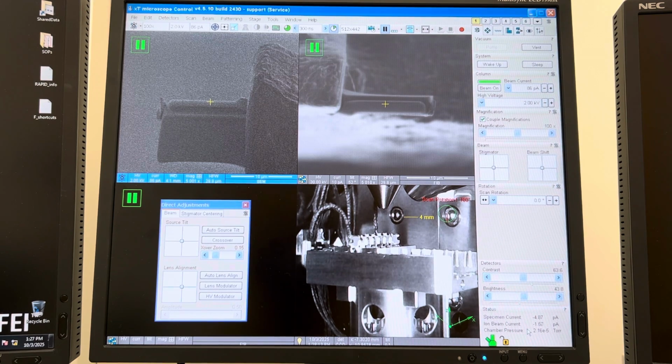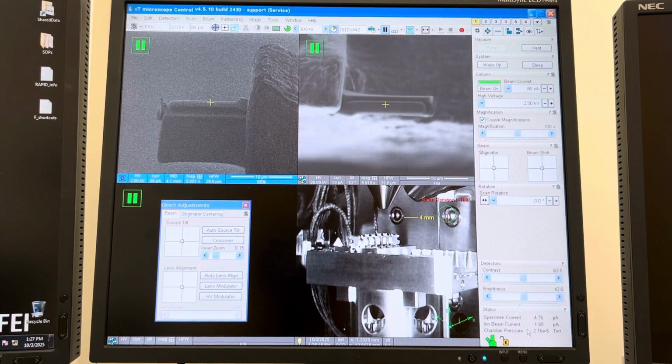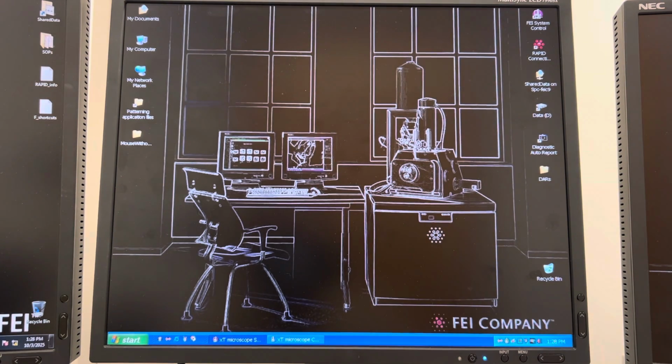It is Friday, October 3rd, 2025, and I'm here on the Helios Nanolab 600i again, and well, I'm kind of stuck. I don't know what happened, but I came in and I found the chamber completely vented. Sometimes what I've seen on this system is, for some reason, the roughing pump to the turbo for the chamber will just randomly shut off. Let me show you actually really quickly here.